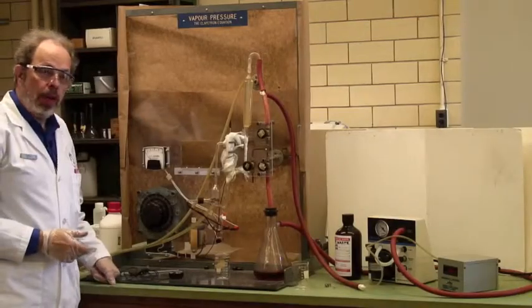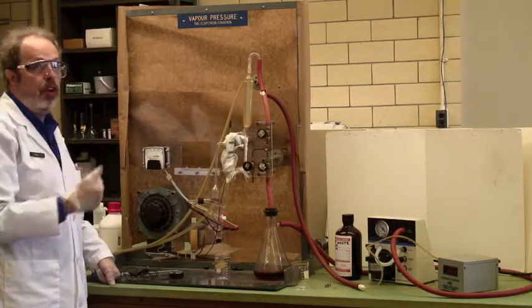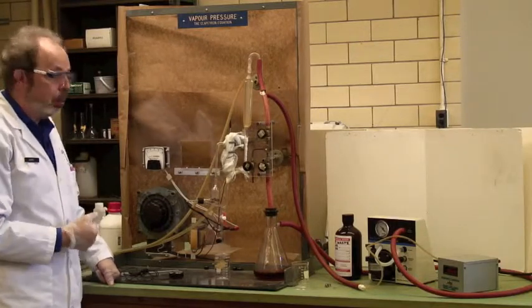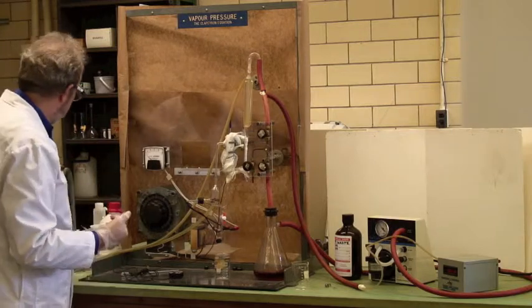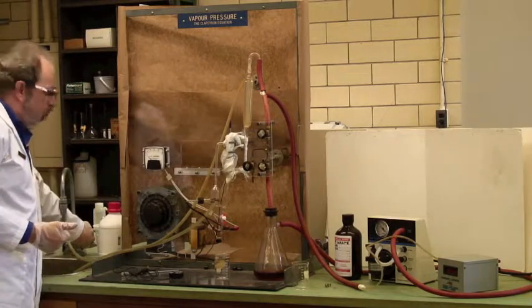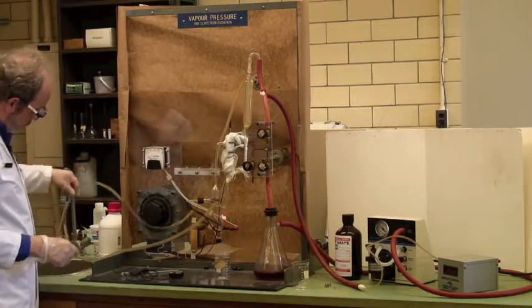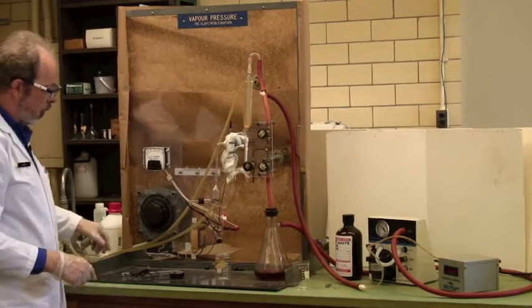Back at the actual glassware, when we're getting things started up, you need to plug all your apparatus in. It should be unplugged overnight, so I've done that already, and turn the condenser water on. So I've now got an actual flow going through my condenser, and there's the water coming out of the cooling end.